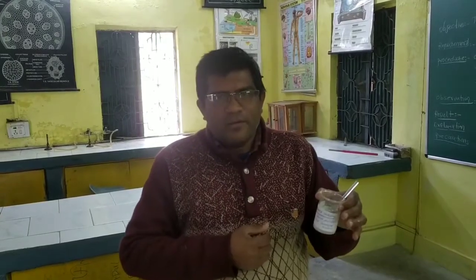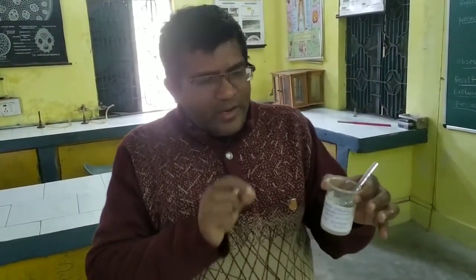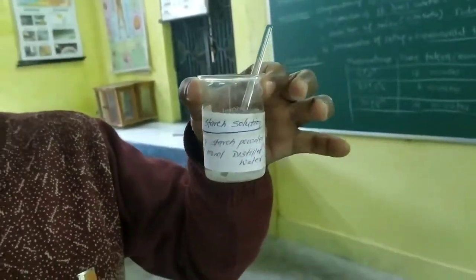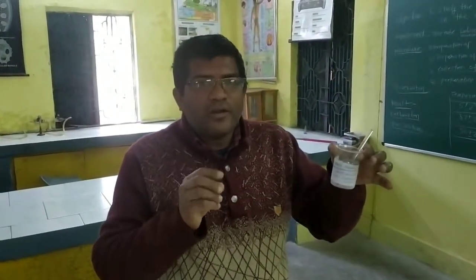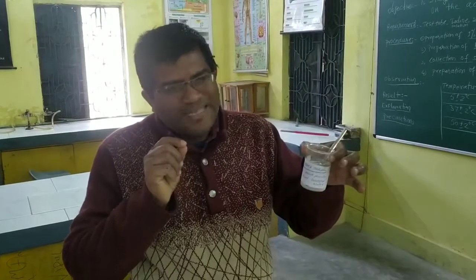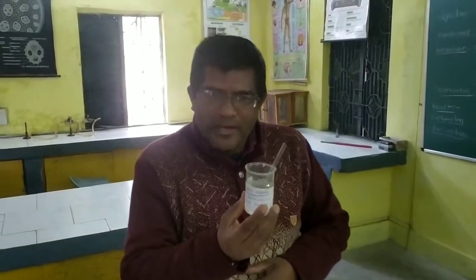After making the paste, we have boiled the distilled water and we have taken 90 ml of distilled water. So total boiled water is 90 ml. So total: 1 gram of the starch and 100 ml of distilled water. And this solution is prepared. It is called 1% starch solution. Remember, 1 gram of the starch powder and 100 ml of the distilled water, and this distilled water was the boiled water, and we have dissolved the starch in it. Then we have kept it overnight.